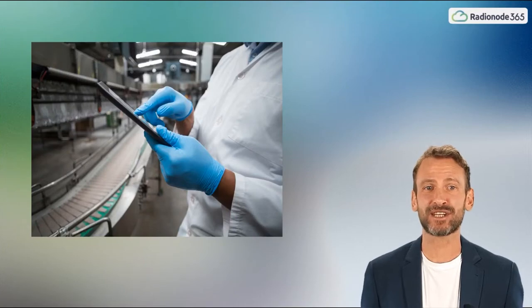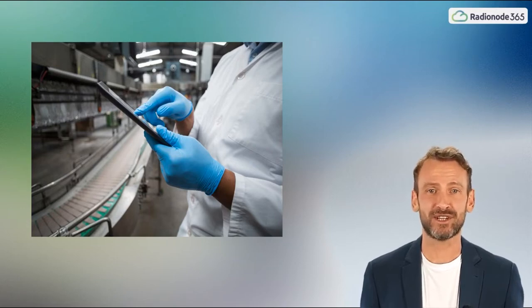Many companies are investing to comply with these regulations. Moreover, as vaccine management needs to be strengthened, the U.S. Centers for Disease Control and Prevention is actively recommending the use of digital data loggers.